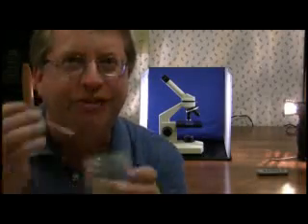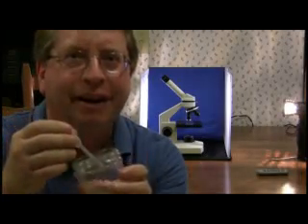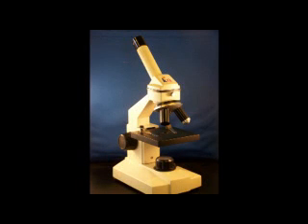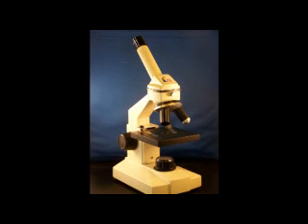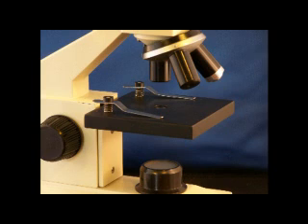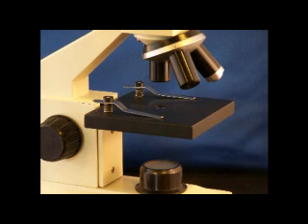You can find a universe in a drop of water, and your microscope will show you the way. This video is for the Life Science Lab, Lesson 1.12, Using a Microscope. The lab has two parts. Download and print the lab instructions and questions from the online school.